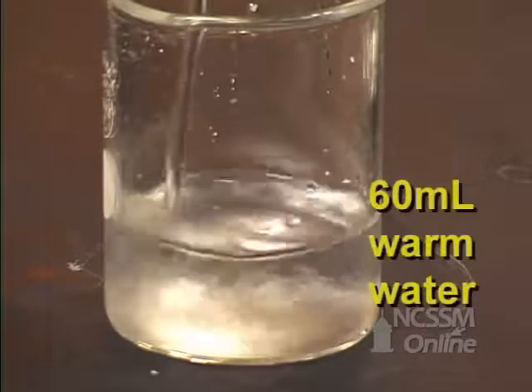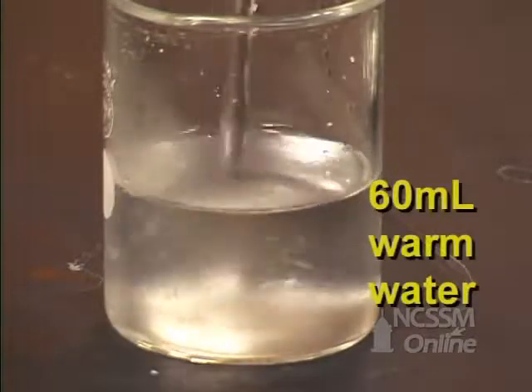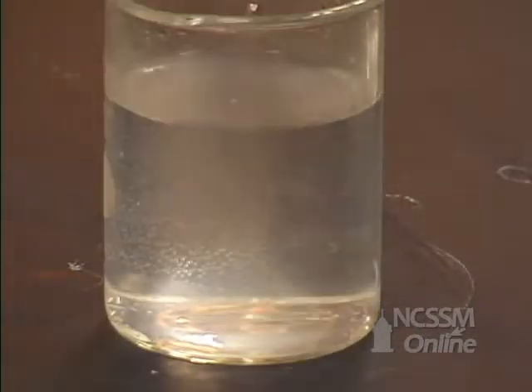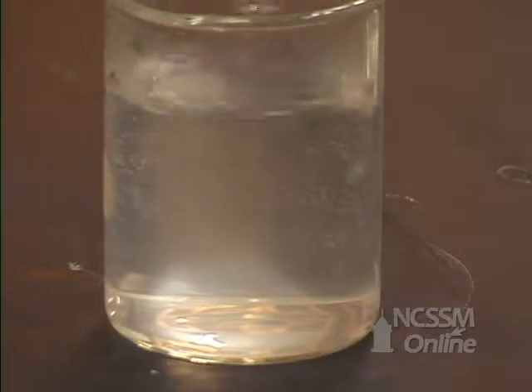Now we're going to add 60 milliliters of warm water. You see it gets cloudy. There's actually a little bit of crystallization that's occurring.